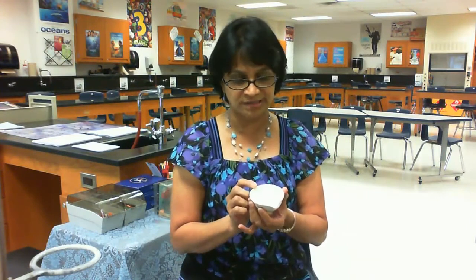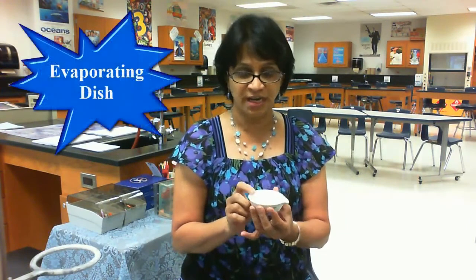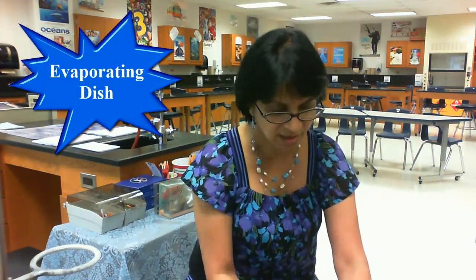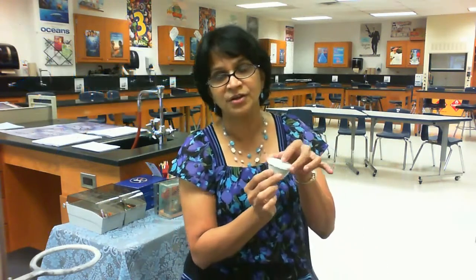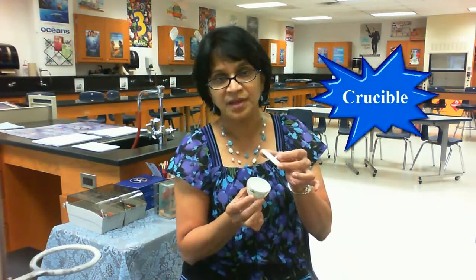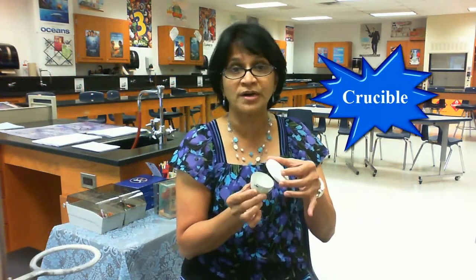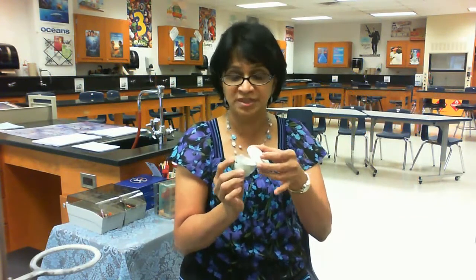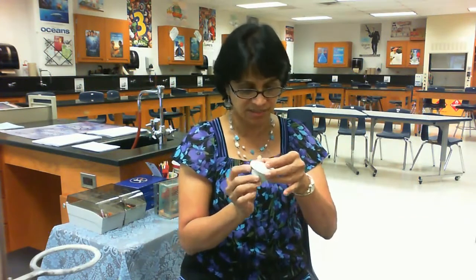Then we have another equipment which is an evaporating dish, and we use it for evaporating some substances. Then we have a crucible with a lid. A crucible is used for heating some substances to very high temperature. It is made of a different material which is heat resistant.